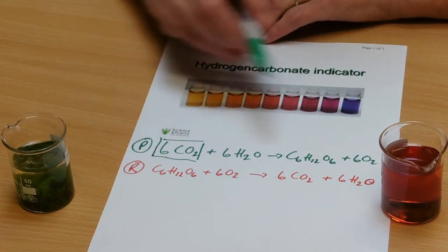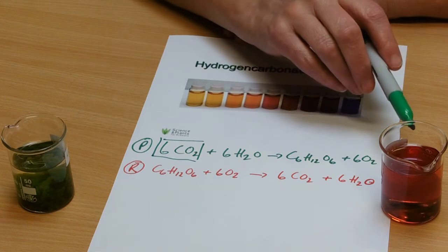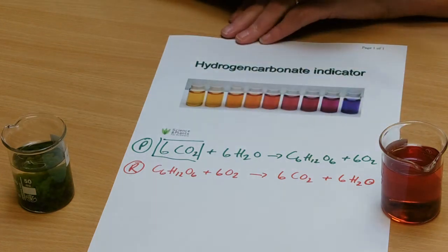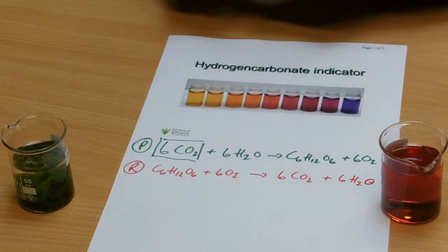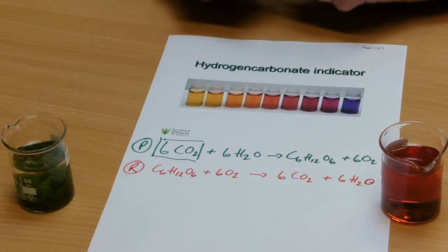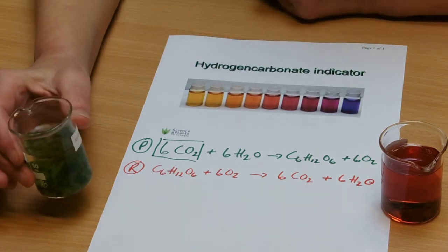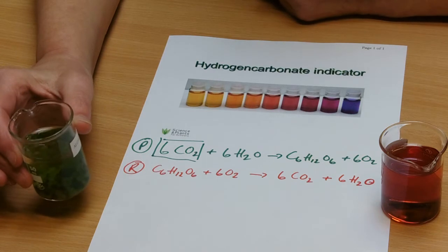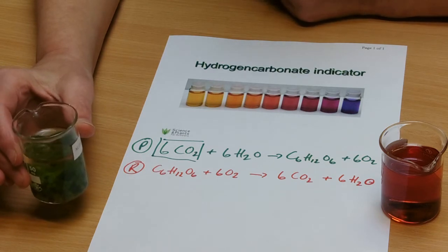So the idea is that as the carbon dioxide is used up out of this, this indicator will change color. Now what's important to remember is that of course these algae balls are not just photosynthesizing. They're doing two things at once.